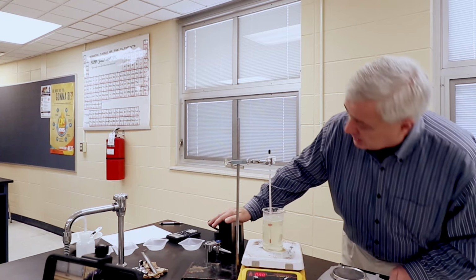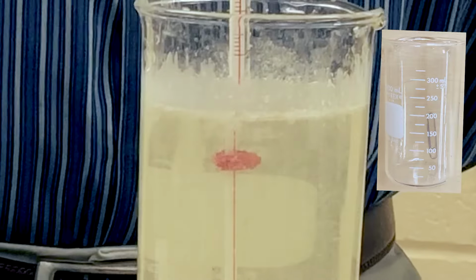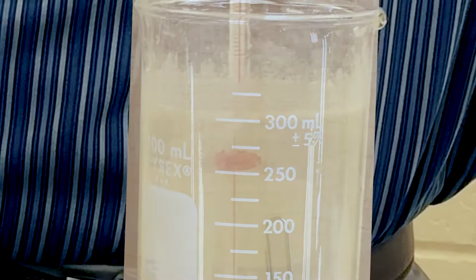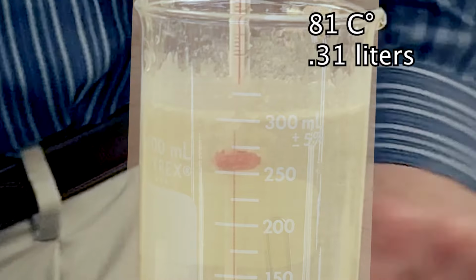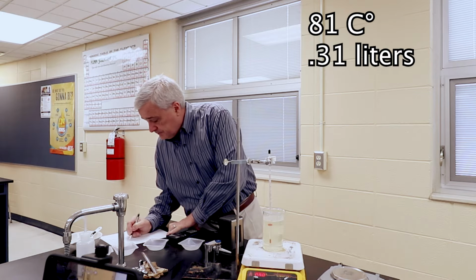And I'm going to call it. I'm going to call it. I've been at this for a long time. I've run my camera battery down twice, and I have a good camera battery. I'm going to call it at 81 degrees. 81 degrees Celsius.